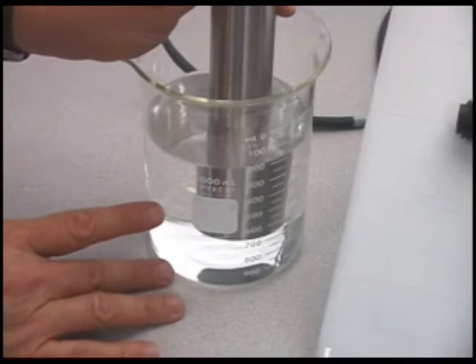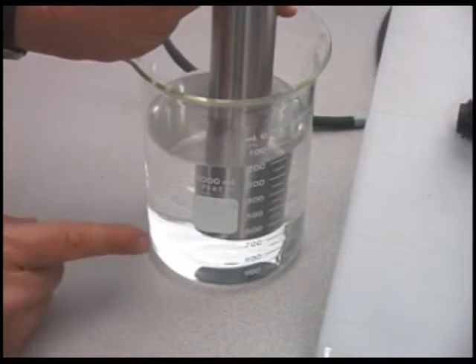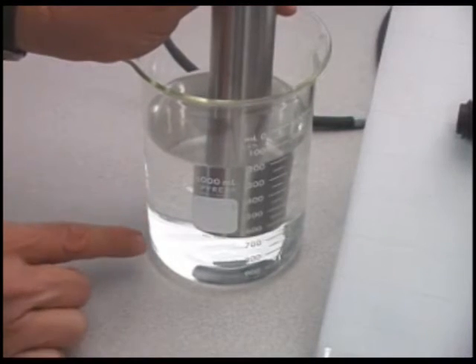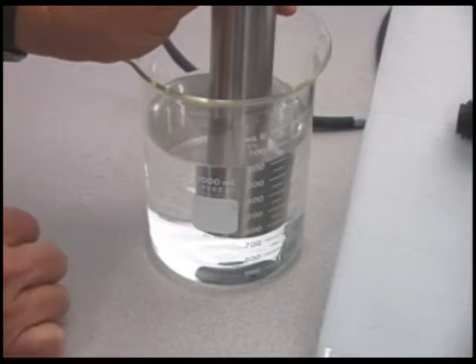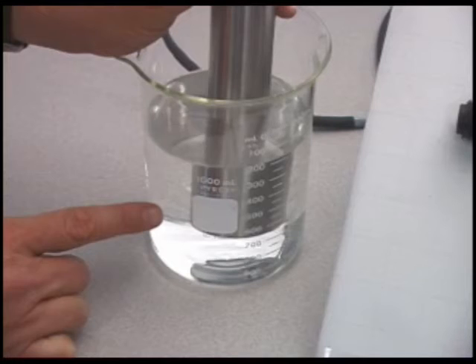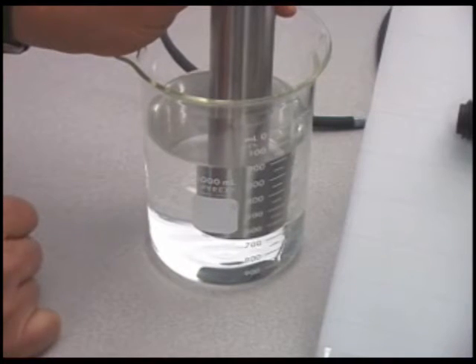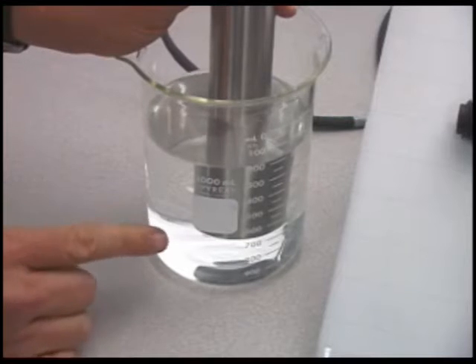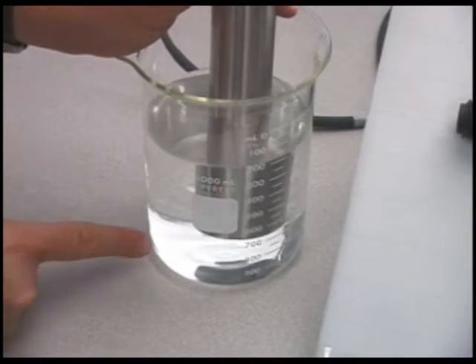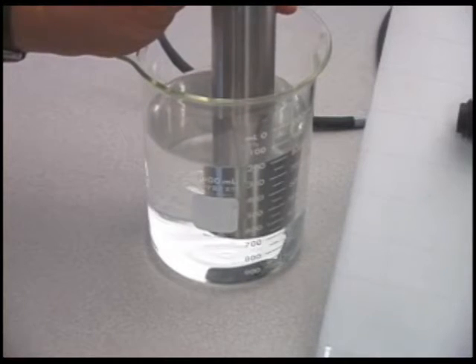There's more information in the manual, but for the best measurement accuracy, you should place the sample in a container that is black and non-reflective, and it's big enough that the probe does not come within about 70 millimeters or about 2.7 inches from any of the walls of the container. We've chosen glass just for the purpose of demonstration in this case.